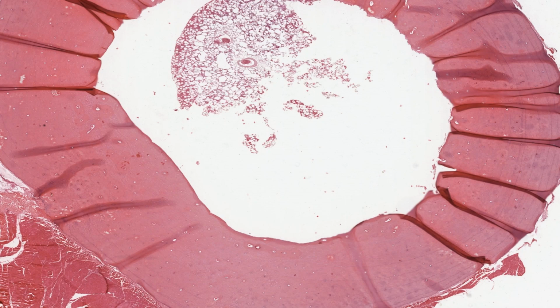This tissue is the femur from a monkey and was decalcified and then sectioned so that you can see its soft components, cells, proteins, and ordinary connective tissue. This is the bright orange-pink ring of bone with periosteum on the outside and the shrunken bone marrow within. The inner surface of the bone will be lined by very flattened osteoblasts of the endosteum. Ignore these artifactual folds in the section.